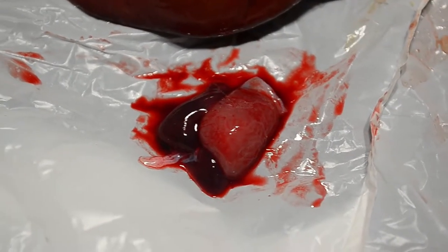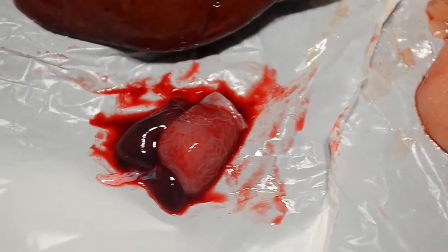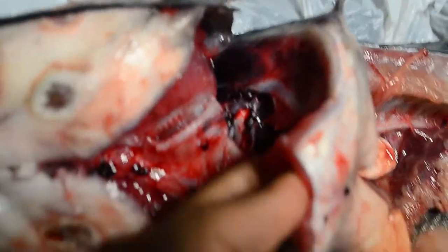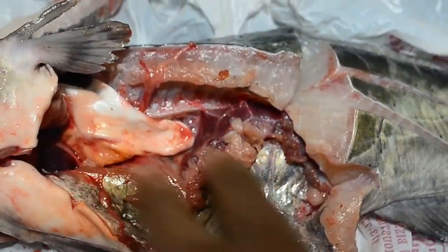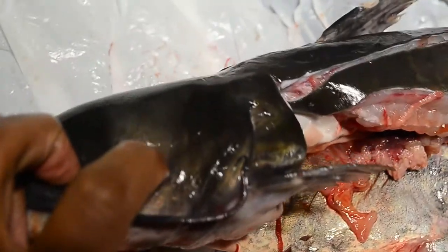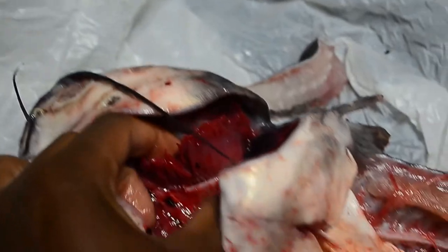This is the fish's heart — it's still moving, so you can see it better. The heart is actually right in there, really close to the gills, because that's where all the oxygenated blood is coming from. It needs to be close to the gills — it's not going to be in the middle of the body where you'd expect; it's up close here. Here's the gill cover called the operculum that covers the gills, and then you have the gills in there.